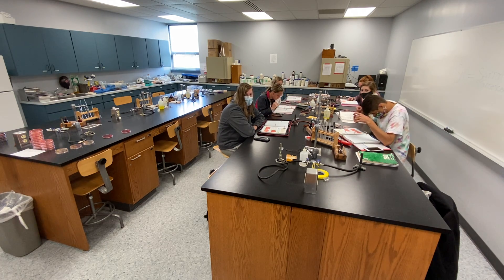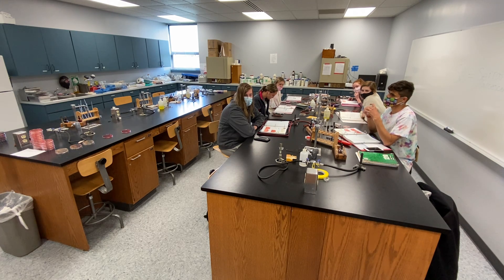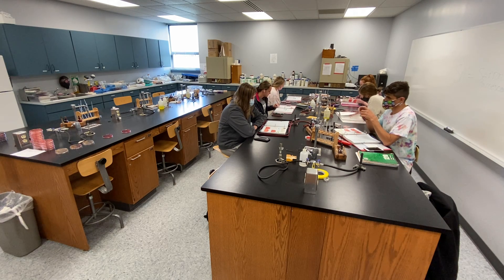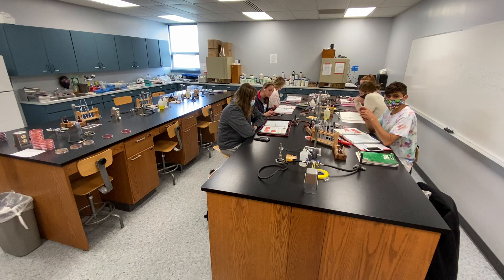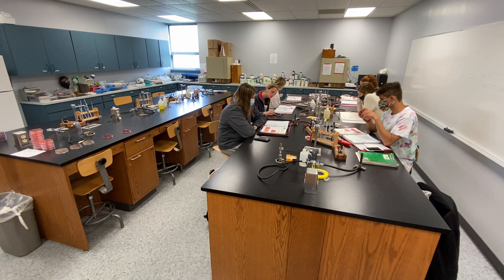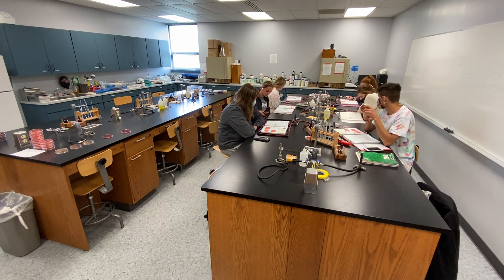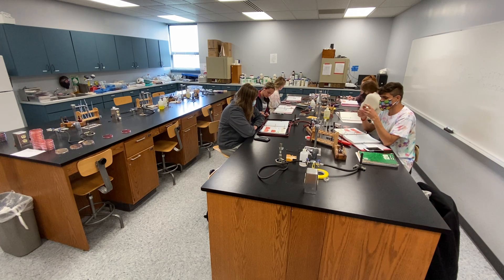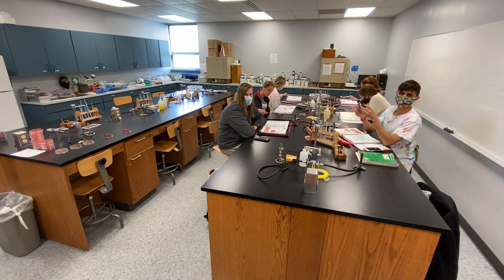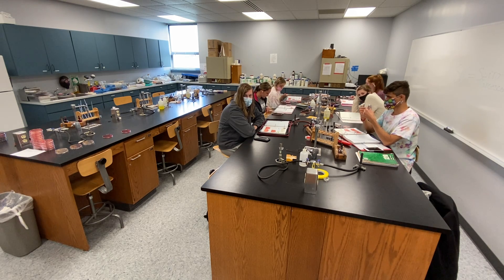I'm going to ask Abram a question: why are there red blood cells in this plate? Anyone — what is the special purpose of adding fresh red blood cells into the agar? What did you see surrounding the area around the colonies? Yes, it's to indicate hemolysis — that's the indicator.